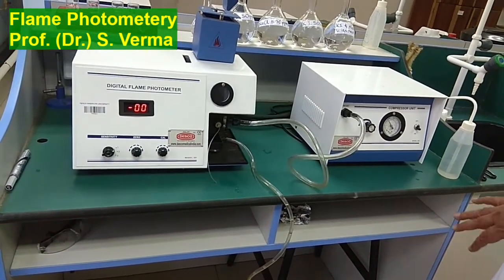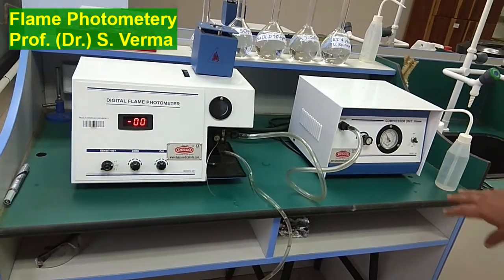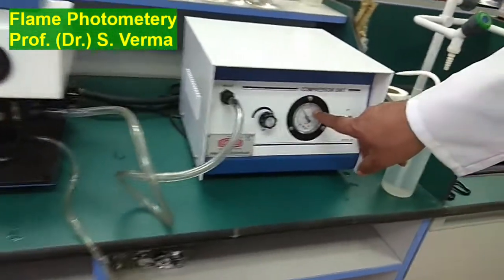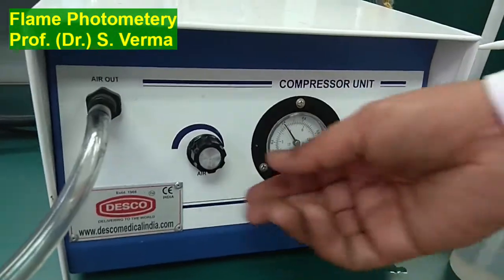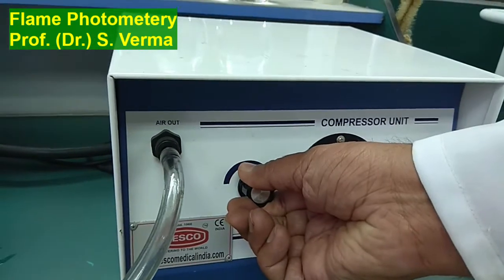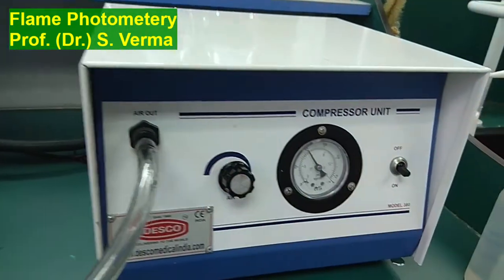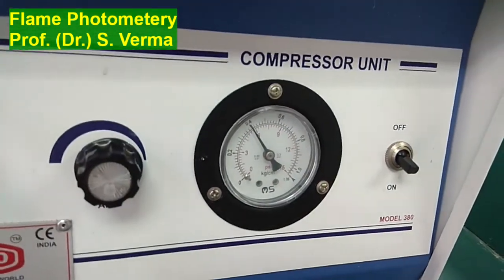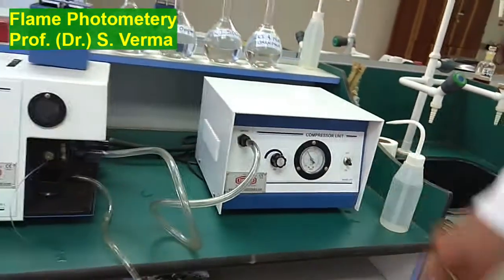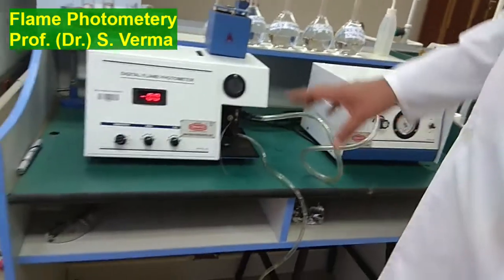So to work with this instrument, what we have to do first up is to ensure that this pressure is between 0.2 to 0.6. I've kept it at 0.4. If it is not between 0.2 to 0.6, we can always rotate this knob to bring it to the desired value. After putting it between 0.2 to 0.6, where it works best, we'll be working with the instrument.